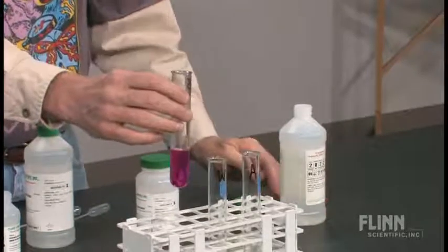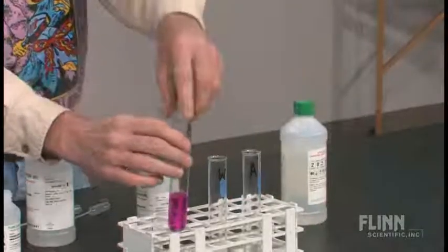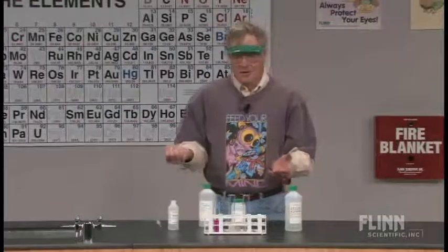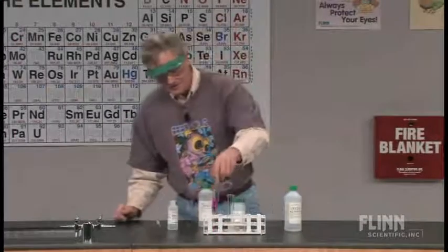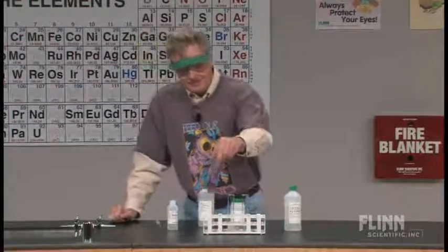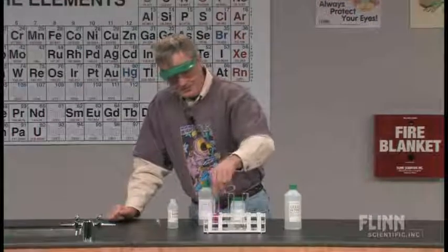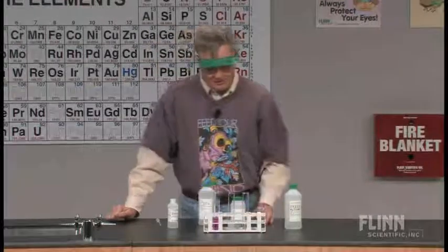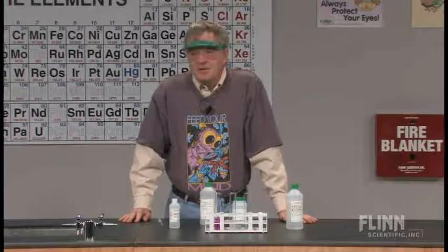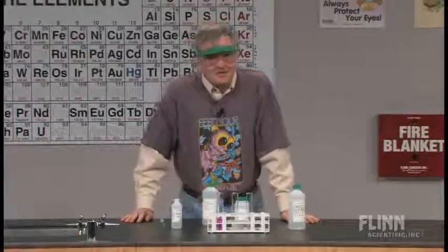If you want to set this up as a really bizarre demonstration, you can go from colorless in strong base, to pink when acid is added to neutralize it back to the middle pH range. Is phenolphthalein pink in a base? Well, it depends on how much base you have.